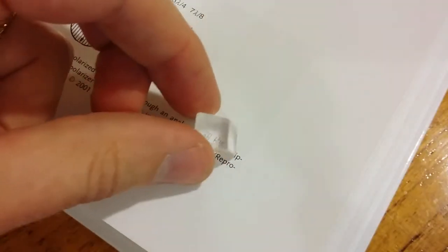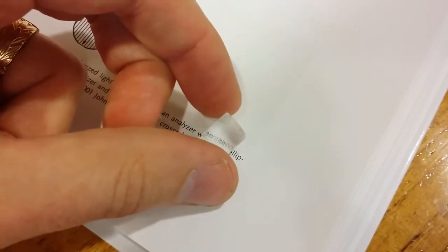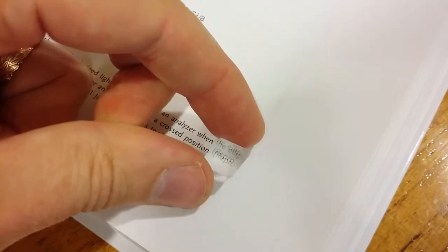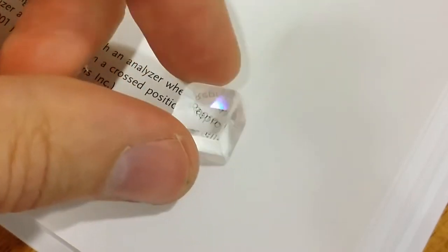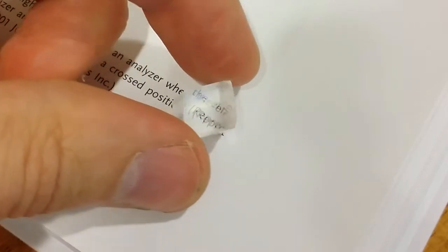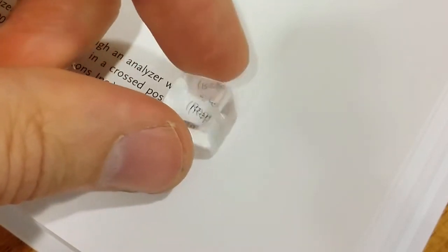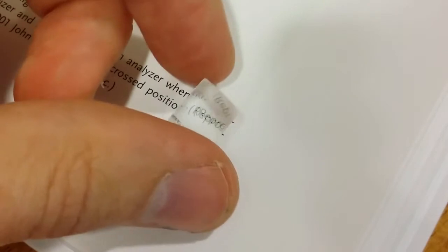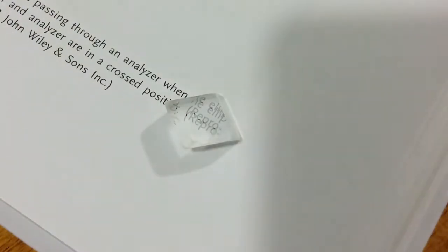What you can see then is that the text becomes double. You see two rows with the same text inside the crystal when you look through it. That's because light in this room is not polarized — it has all the polarization angles. So light going through this crystal at one polarization angle will take a different pathway compared to another, creating two images that you see when you look through it. This calcite crystal is unique because it has an extremely high effect on this, so it is visible just by looking through the crystal.